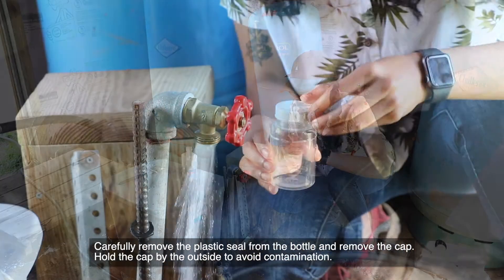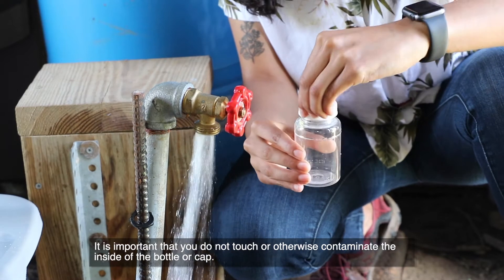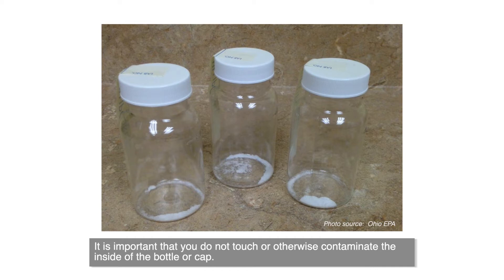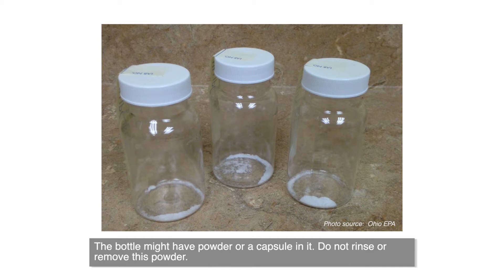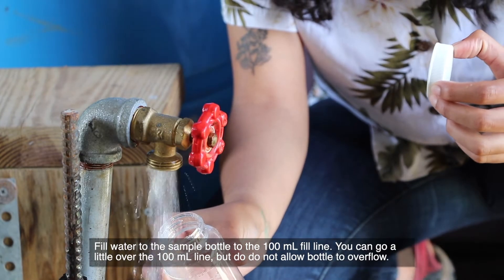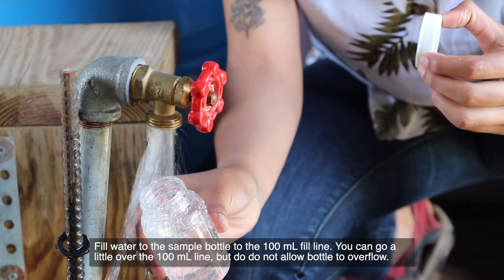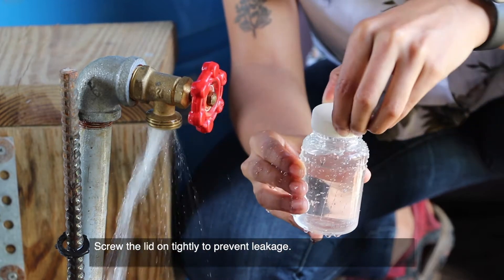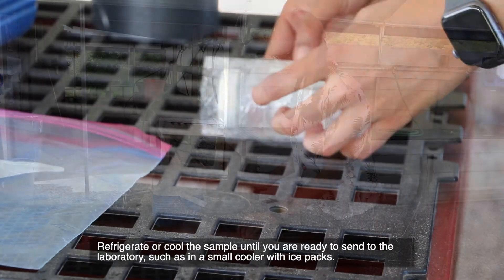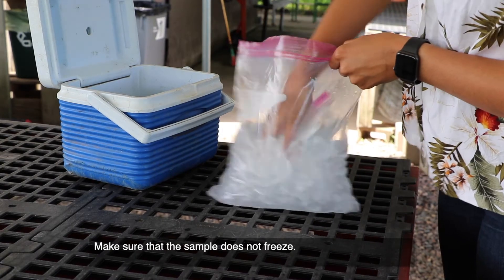Carefully remove the plastic seal from the bottle and remove the cap. Hold the cap by the outside to avoid contamination. It is important that you do not touch or otherwise contaminate the inside of the bottle or cap. The bottle might have powder or a capsule in it — do not rinse or remove this powder. Fill the sample bottle with water to the 100 milliliter fill line. You can go a little over the 100 milliliter line, but do not allow the bottle to overflow. Screw the lid on tightly to prevent leakage. Refrigerate or cool the sample until you are ready to send it to the laboratory, such as in a small cooler with ice packs. Make sure that the sample does not freeze.